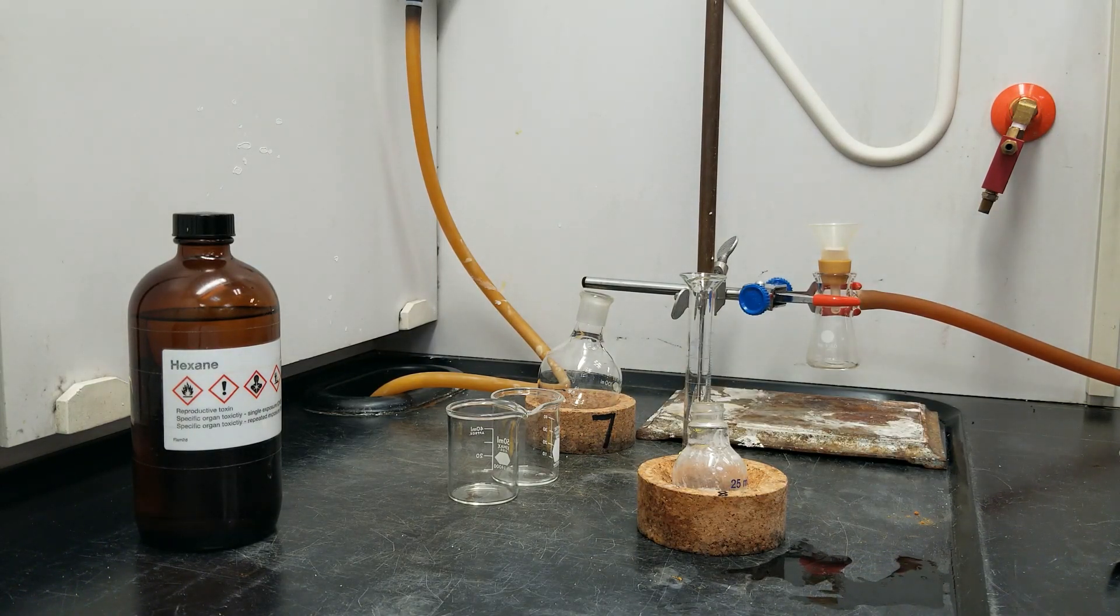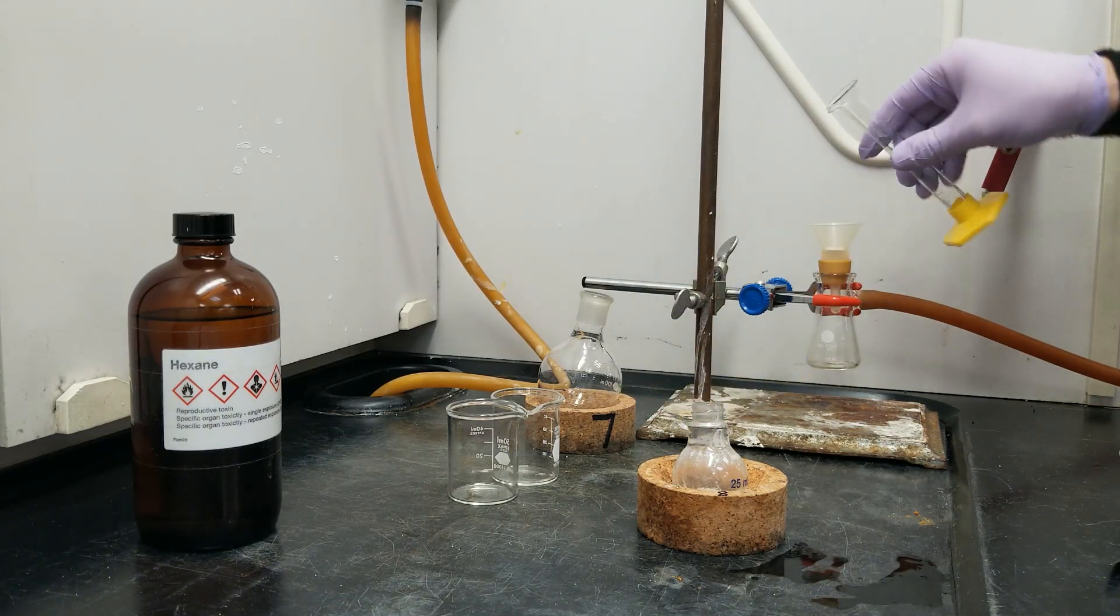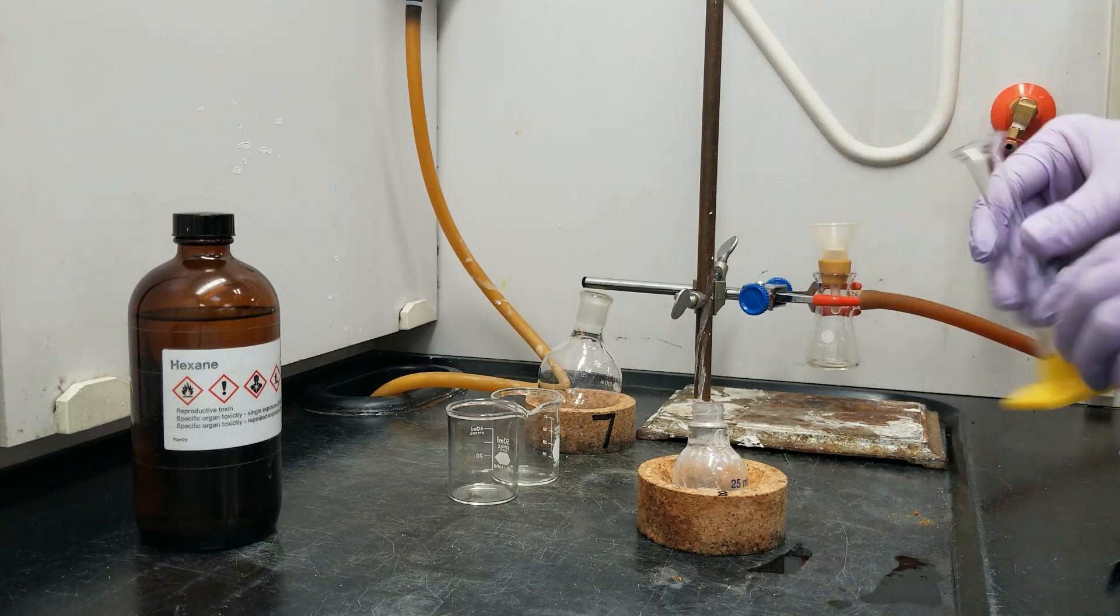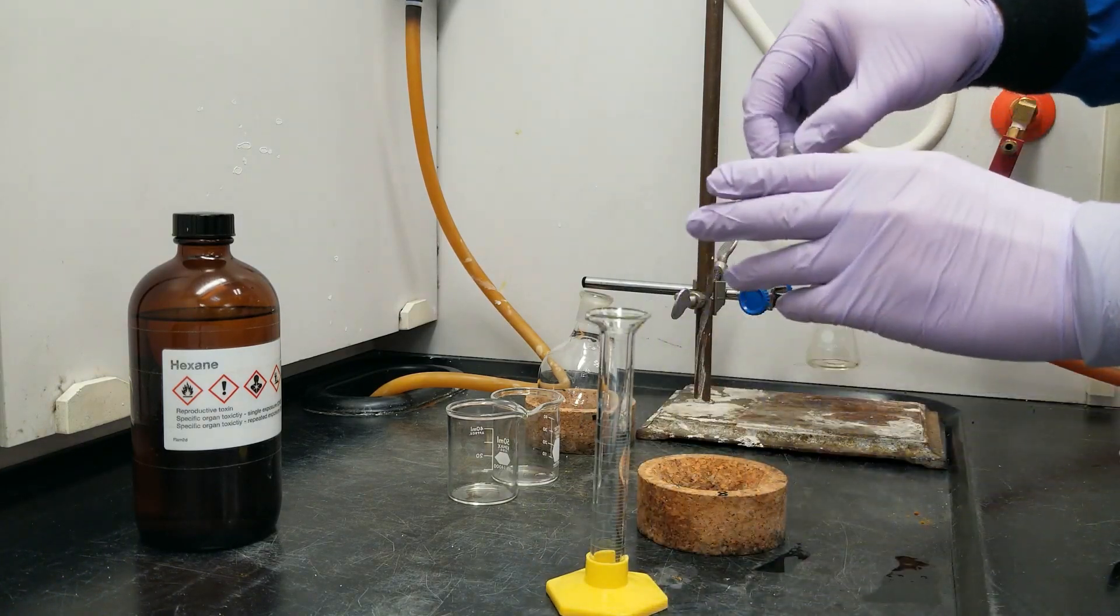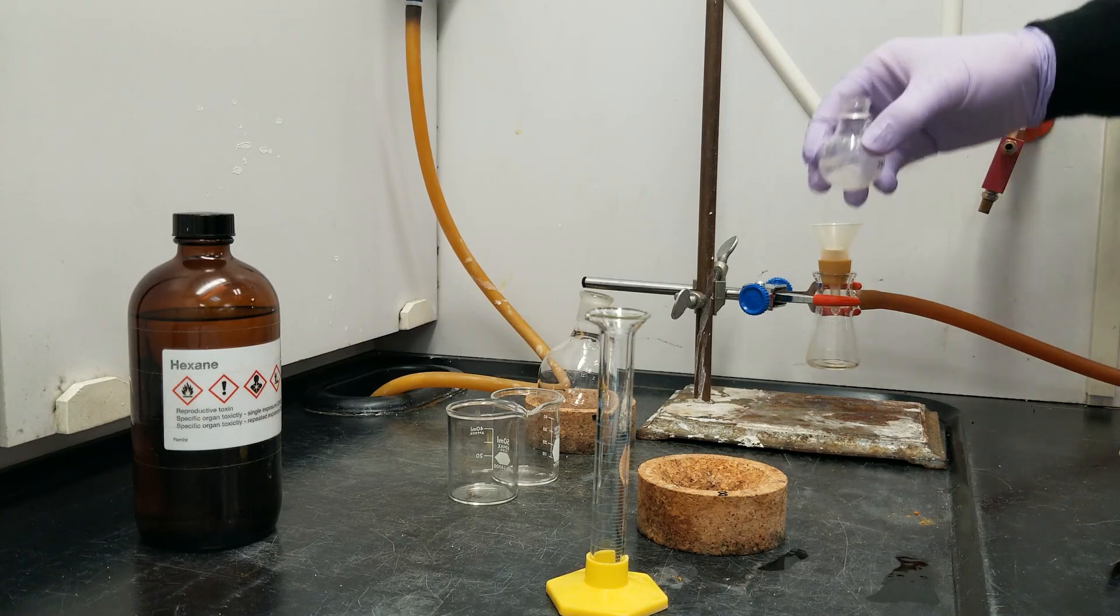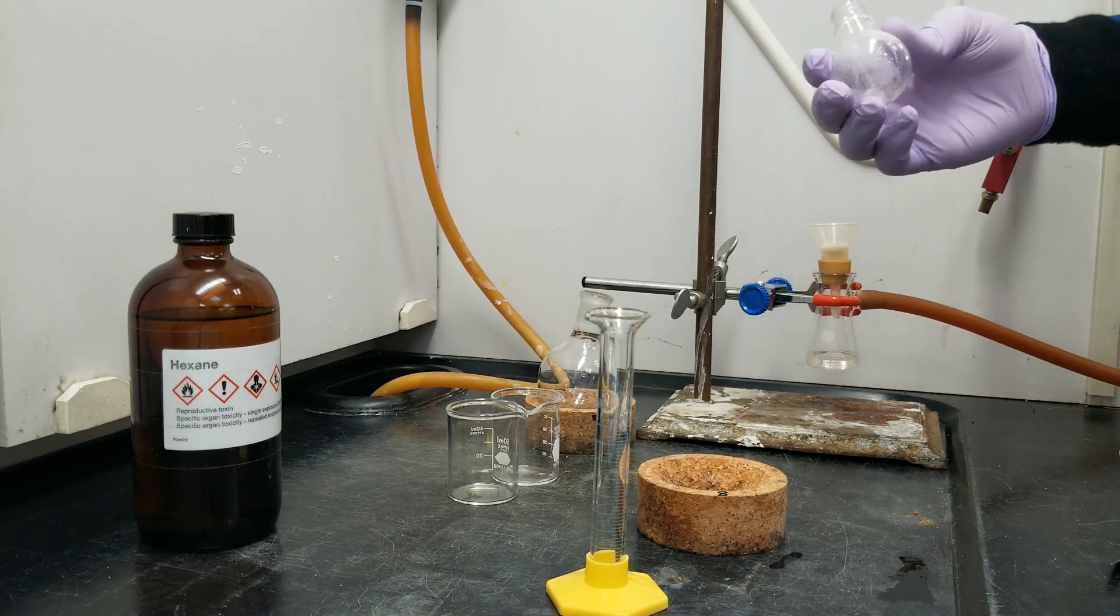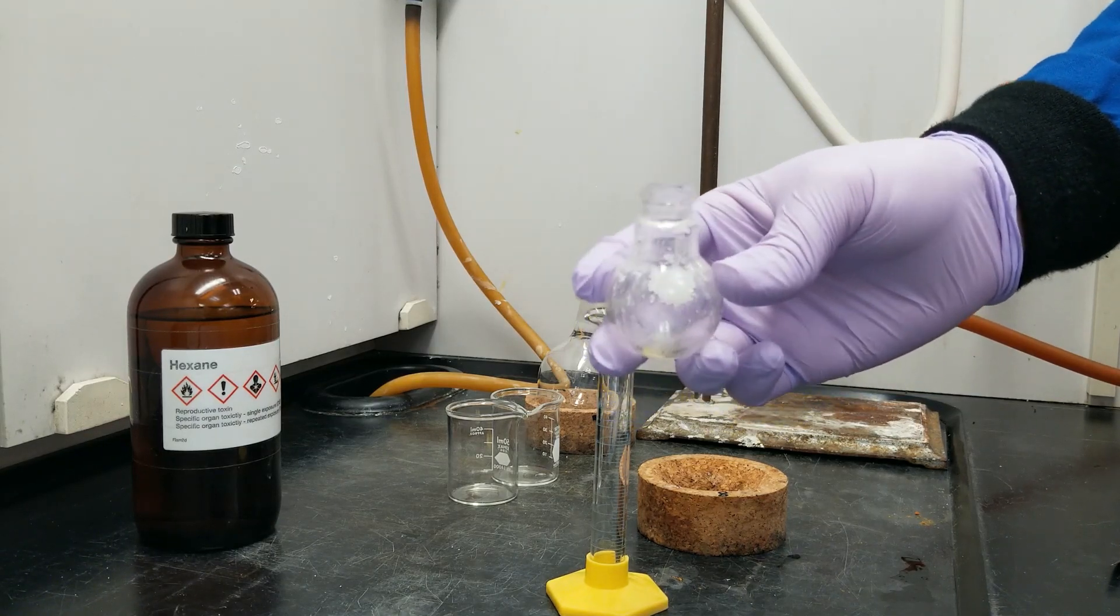I've got a teensy bit of spare hexane, which I'm going to wet down my filter paper with. And then I'm going to try to get this all kicked up into solution so I can pour. And that worked okay. I've got about half of it out.